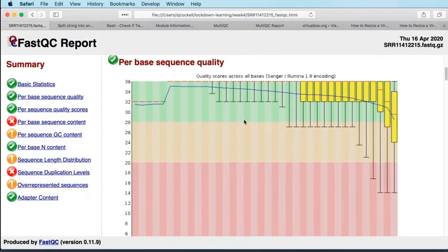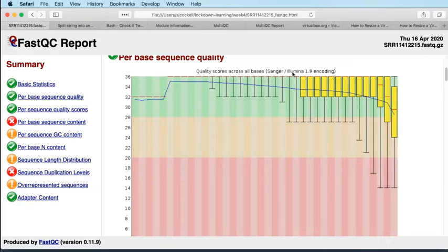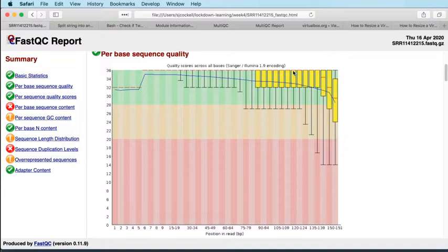Okay, so then the first report of any real substance, and let me just try and make it a little bit smaller so it all fits on the screen. There we go. Is per base sequence quality, which is a box plot, which is summarizing the sequence quality at a particular position in the read across your whole experiment. So here we've got 4.25 million sequences. So this box here is summarizing the quality of all of the bases at the first position in all 4 million of those reads, and it's showing you the distribution of quality in those reads, where what it means by quality is the Phred scaled Q score that is present in the FastQ file. So let's have a quick look at the FastQ file, and I can show you what I mean by that. So here we go.